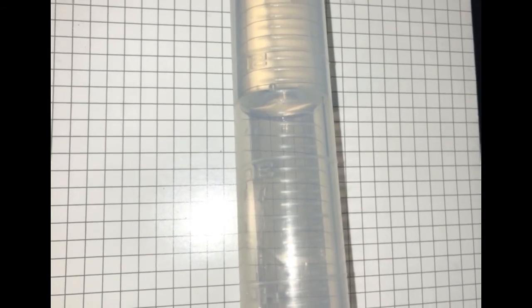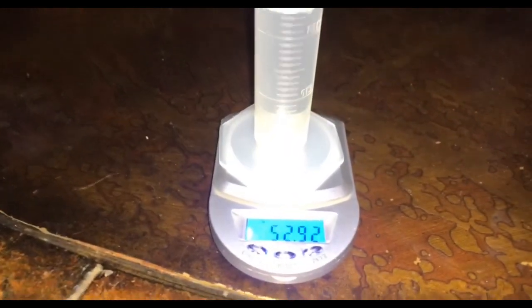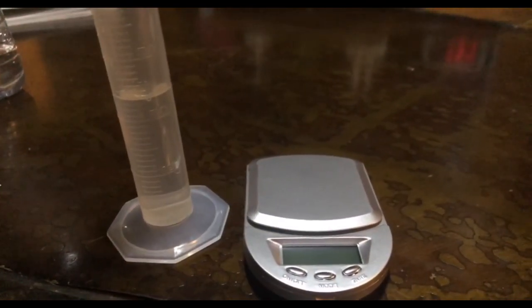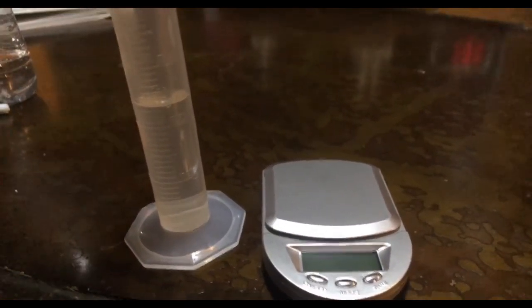Next, you will solve for the volume high and low, and for mine it is 24.1 for the high and 23.9 for the low. Next, we will turn on the balance and weigh the mass with the water in, and record on our chart. Next step would be to repeat the same process again for another trial and record your calculations on your tables.